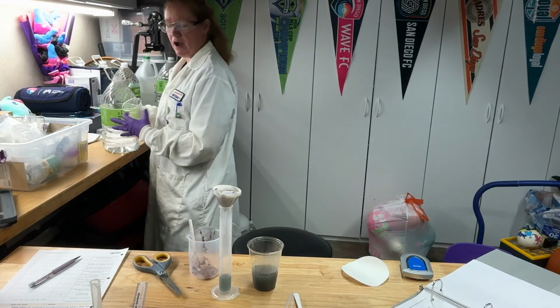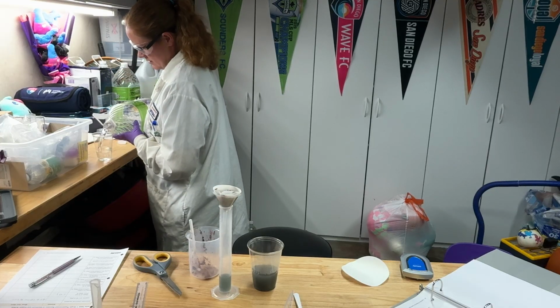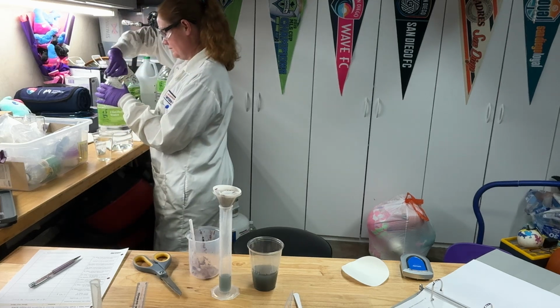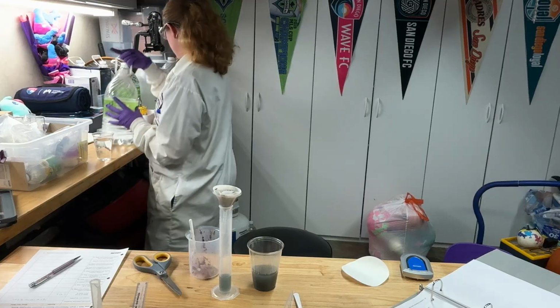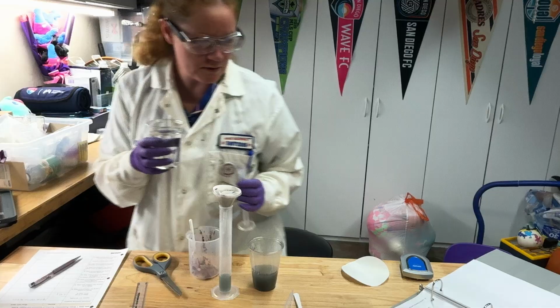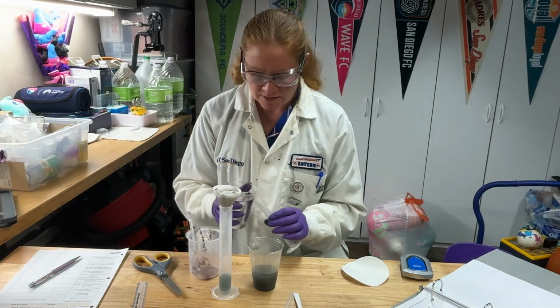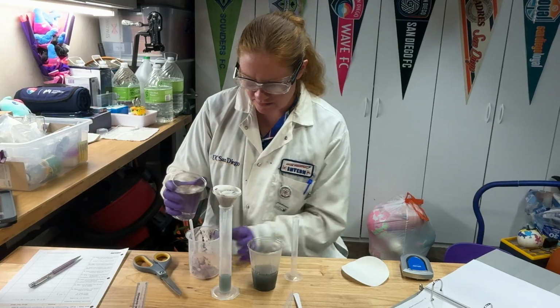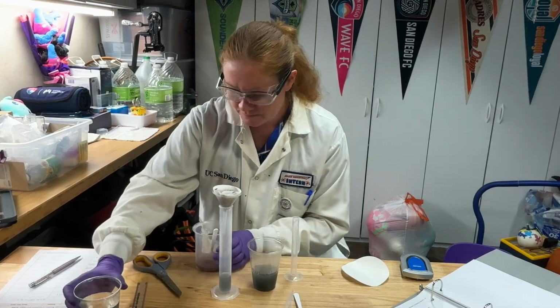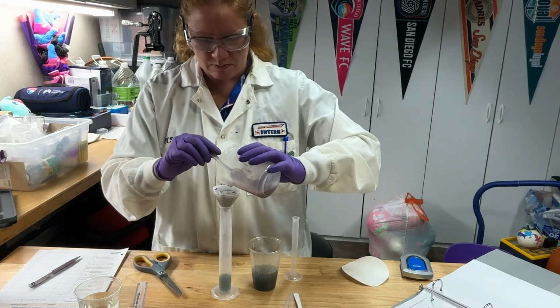The easiest way to pour, I don't like to pour out of this thing, so this other plastic cup I got out, I'm going to pour into there. And now I can go ahead and do my rinses. The rinses, it's not super critical that you are perfect about it. It's going to tell you to add about 20 mL, so I'm just going to add a little bit in there. Stir it around and then carefully pour that into here.